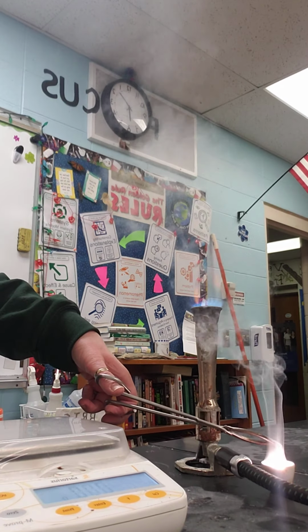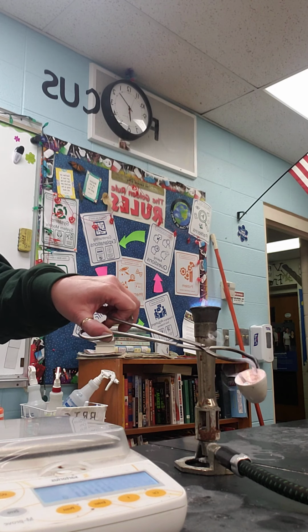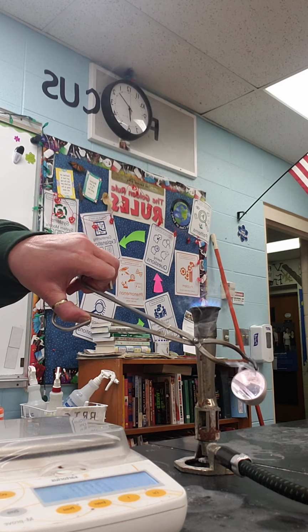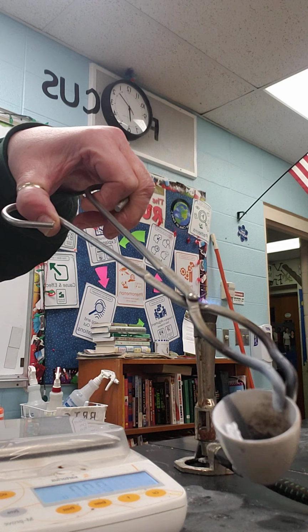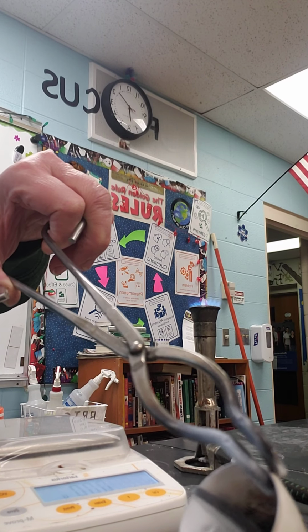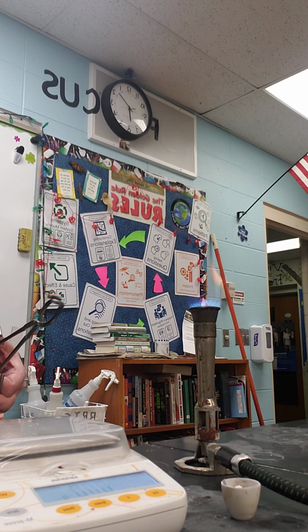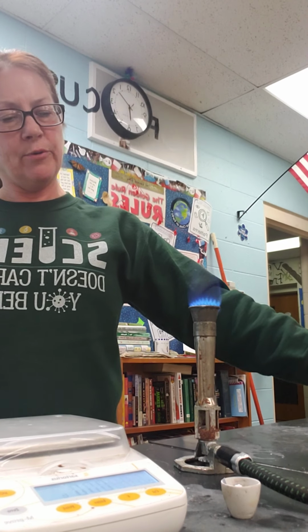Can you see that gas being given off? See the gas? You saw the very, very bright light. Still see it in there? Okay, and you can see, hopefully, that the magnesium, which was kind of blackish before because it was oxidized, is now white. So, what did you notice as far as chemical changes? All right, now I'm going to let that crucible cool a few minutes.